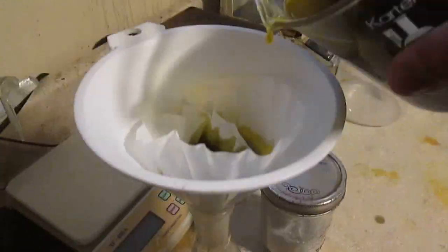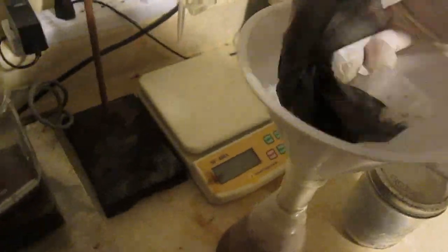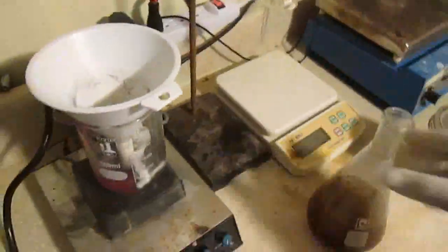Hello and welcome! In the previous video I isolated mercury from Cinnabar in a rather sloppy fashion and I was asked if my mercury was invisible in the mirror.